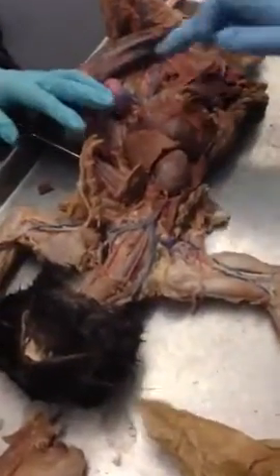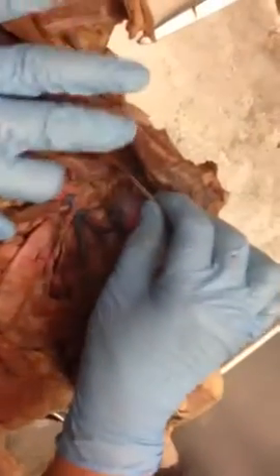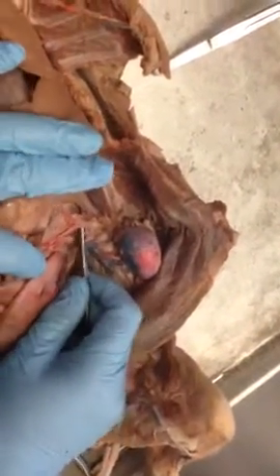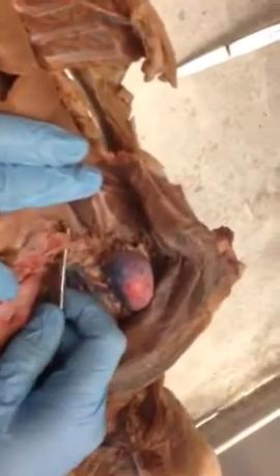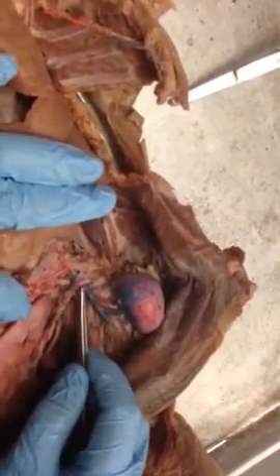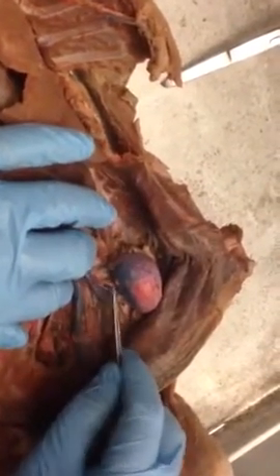Now down here in the abdominal, which you guys have the beautiful abdominal vasculature here. So here's the diaphragm. So now this is the abdominal aorta, descending abdominal aorta that we're coming off here. So this is where we use that canned soup really good in cups. So the first one is celiac trunk. Soup. Superior mesenteric. Really. Renal.